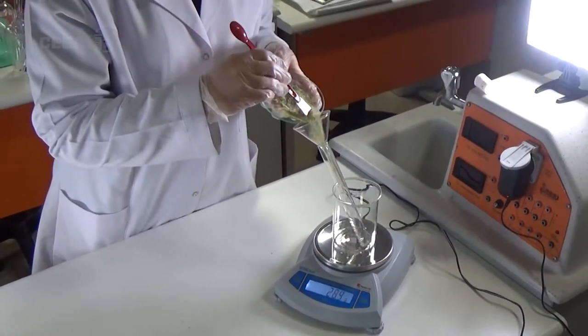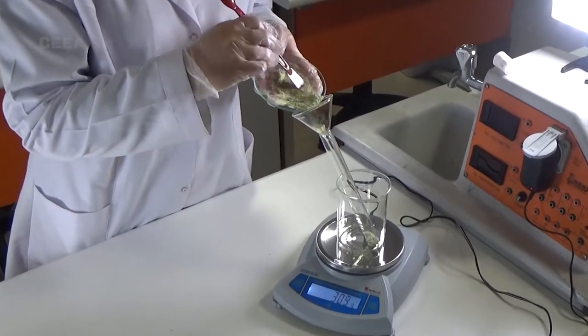Sulfur powder and iron powder are put into the test tube and the weight is measured.